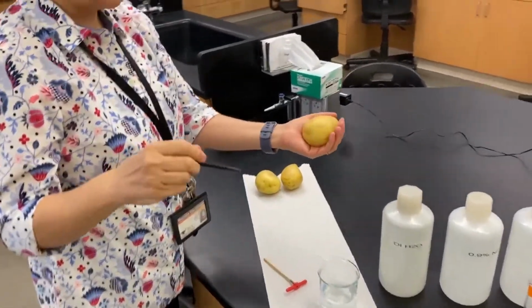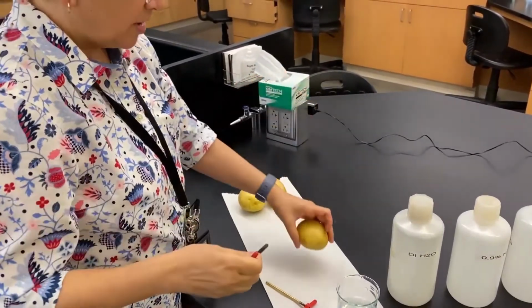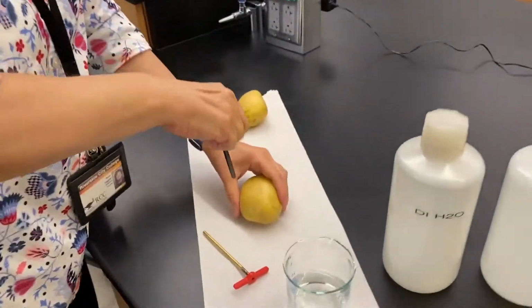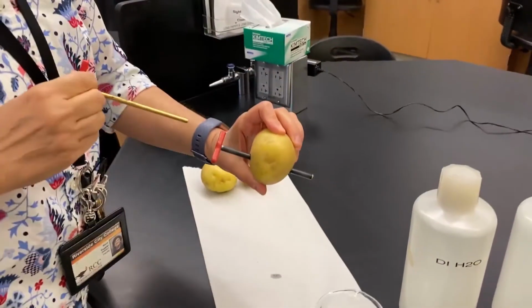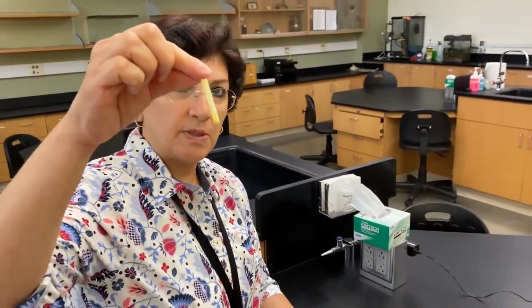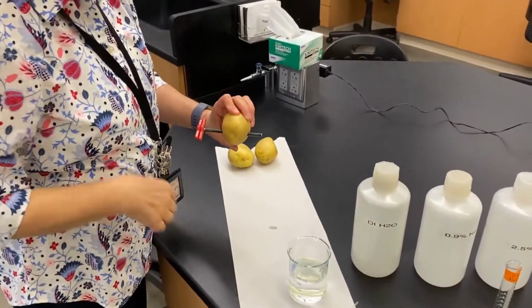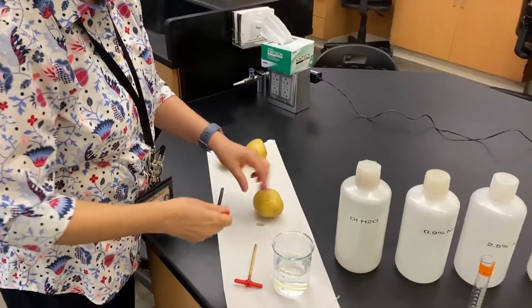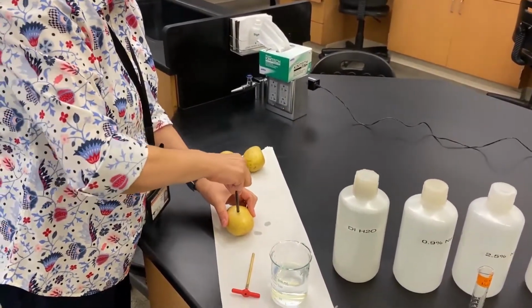We never put the potato on our hand because, yes, this corer can actually hurt you. You put your potato on the flat surface, and we go straight down, and it's actually pretty easy and satisfying to do. So you get a really nice piece of potato. I always bring some water with me because I want the potatoes to be hydrated as I'm collecting all my specimens. We're going to get 4 cores because we have 4 treatments.